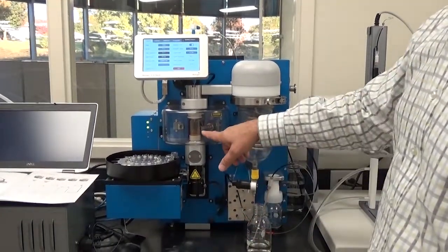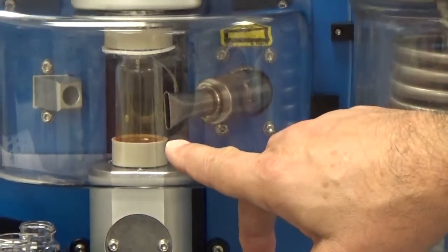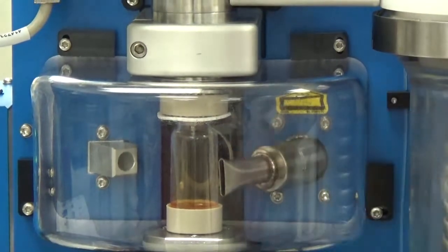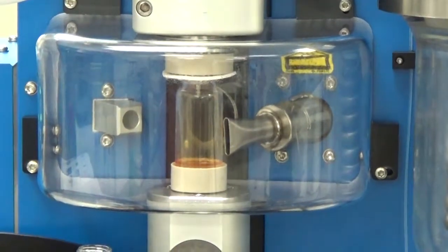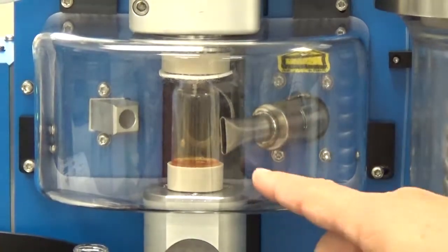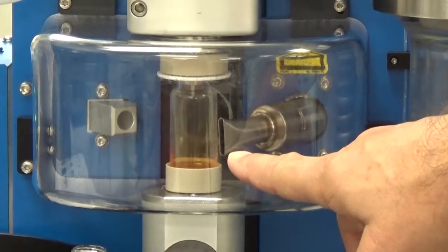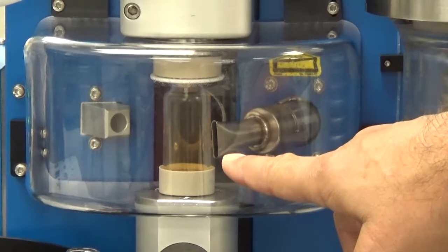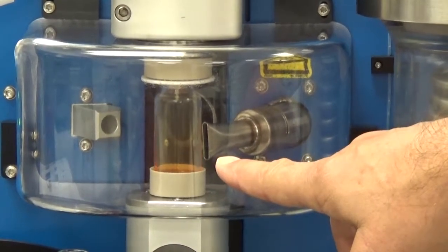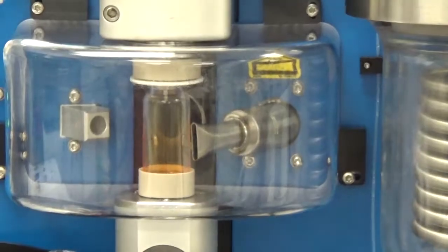Okay, so the spinning is shut down and we're equalizing pressure. You can see that we're adding solvent to the vial right now. And because most of our dried material is up on the sides, like on this vial here, we need to rinse that down. So what's going to happen first is we're going to add some solvent and then we're going to spin the vial up. There it goes. We've programmed it to spin it up 5 times, and what we're doing is we're redissolving the material off the side.